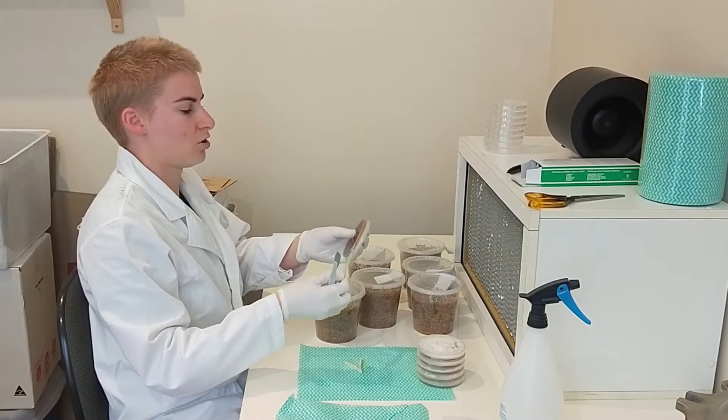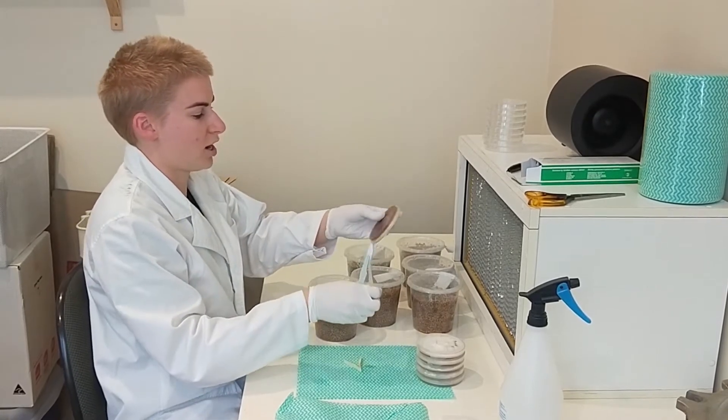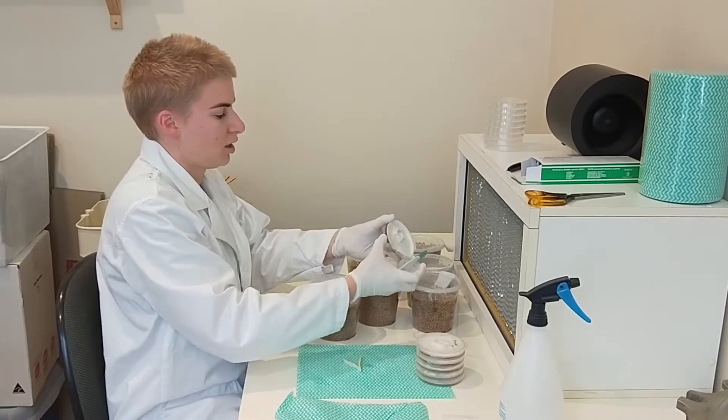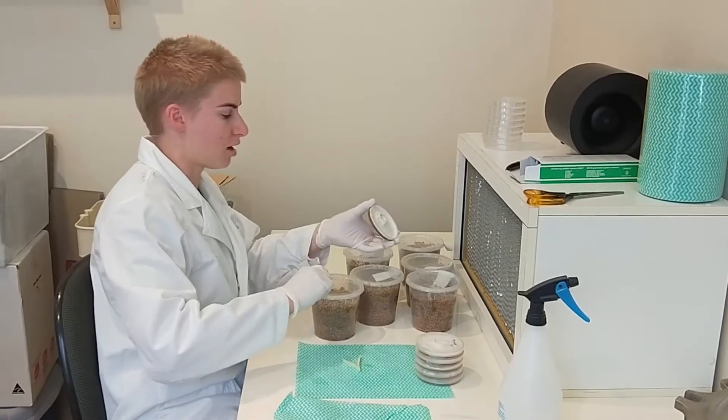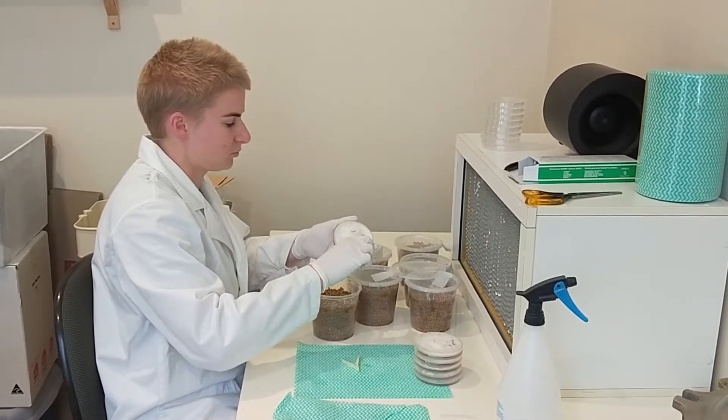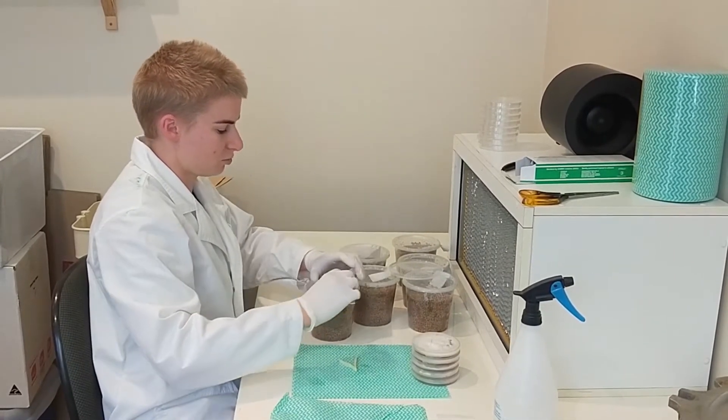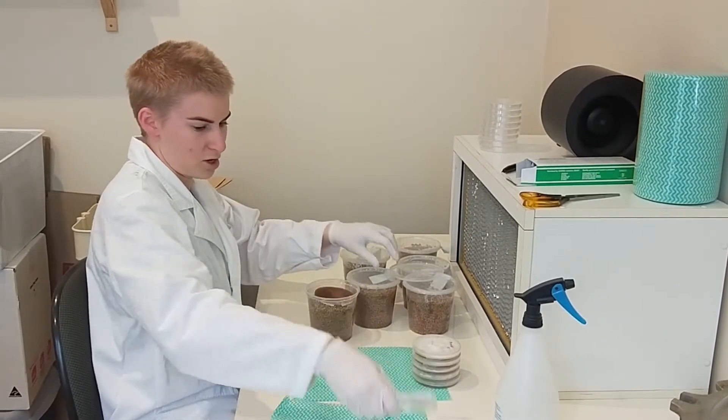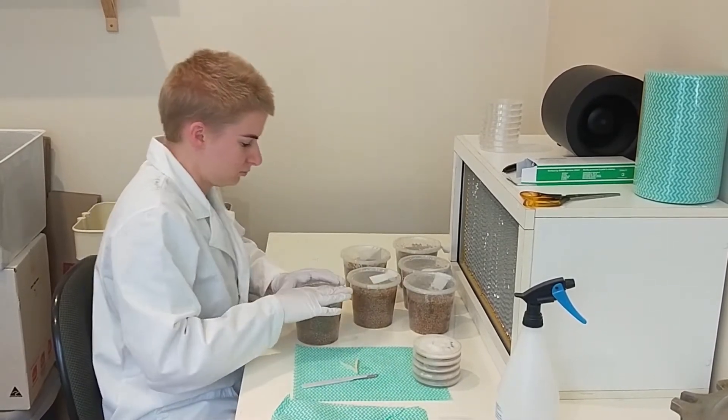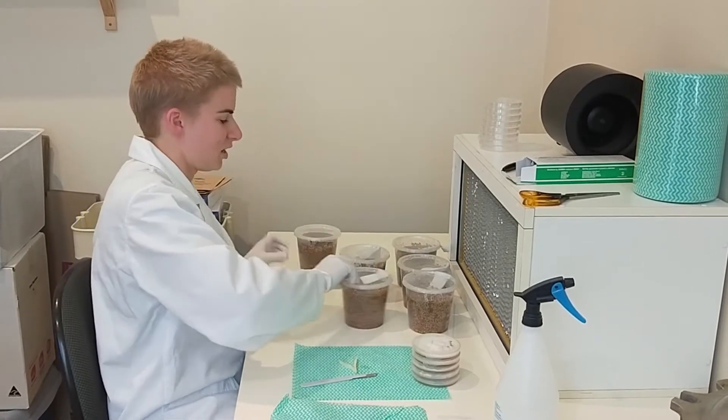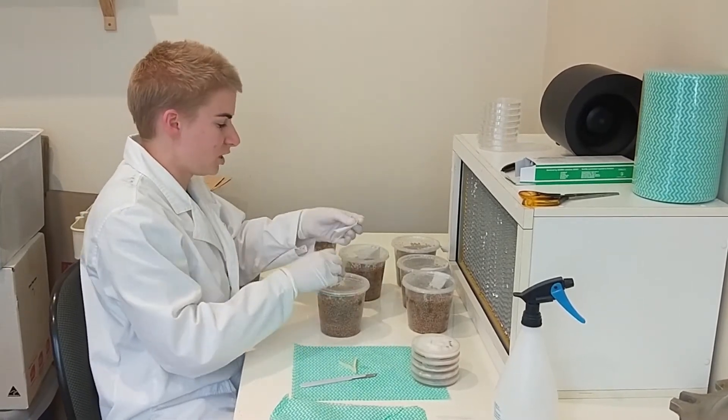We're just going to take the whole culture and plop it right on top of the grain, all while in this sterile workspace. Just prise it out with a sterile scalpel, right on top like that. And voila. We'll just repeat that for the other ones that we've got here.